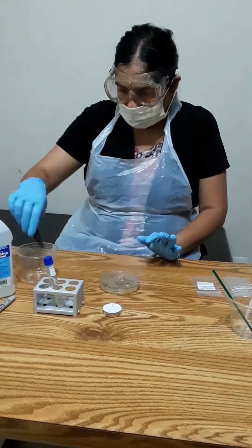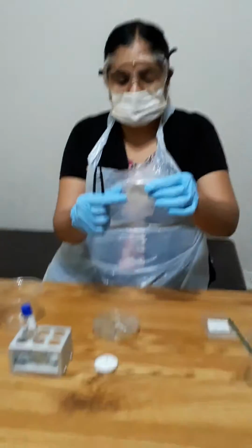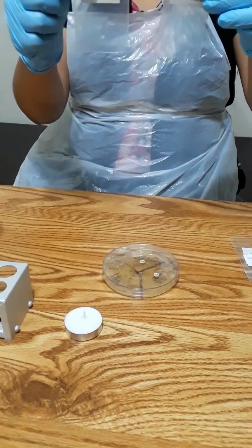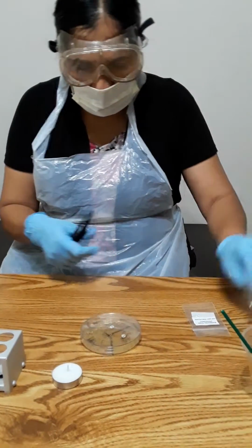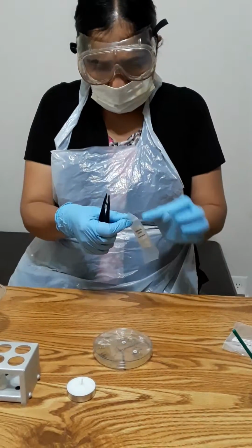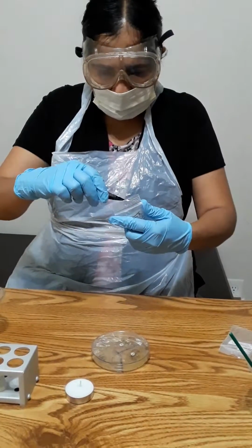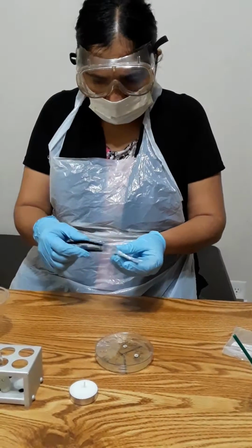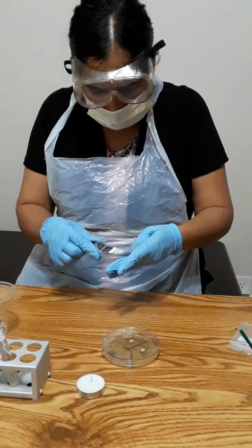After that, I have my tweezers here, I dried them well, and then I took the antibiotics. You can see the discs here. I already did 2 just to save time in the video. I already did gentamicin and novobiocin, but I'm going to demonstrate one, so you know what I did. The one remaining is penicillin, so I'm going to open that here, and I'm going to grab that disc here. You can see the disc here.